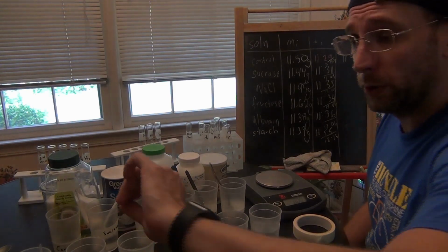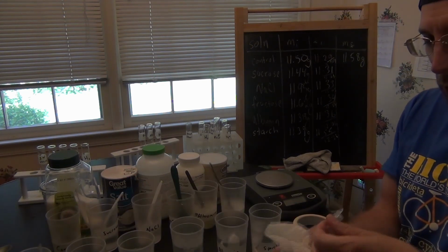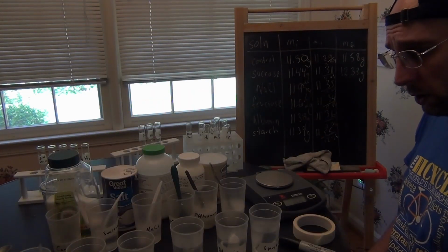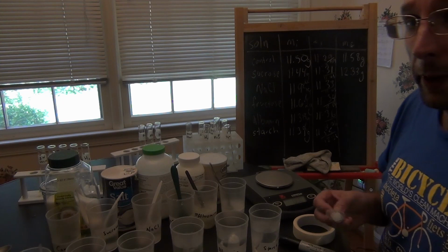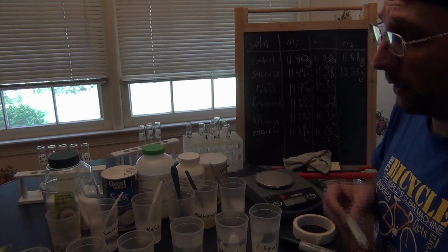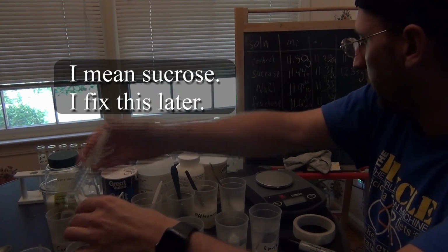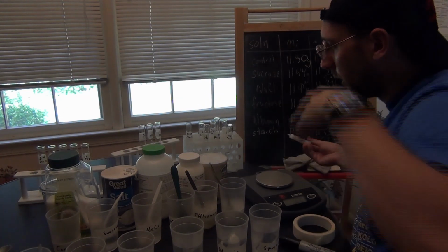Alright, so the next one is sucrose. Pull it out. Same thing. Wipe off the ends. Okay, 12.33. While I'm doing this, actually, what I'm going to do is take samples from the outside of the containers to see what's going on. We're going to do some tests to see if there are substances on the outside. So while I wait for my next time, I'm going to pull out 10 mils of fructose and put that in one of my containers over here. Then I'm going to clean this out.